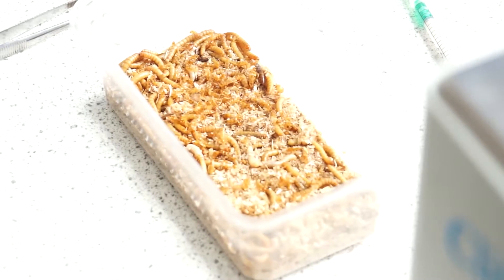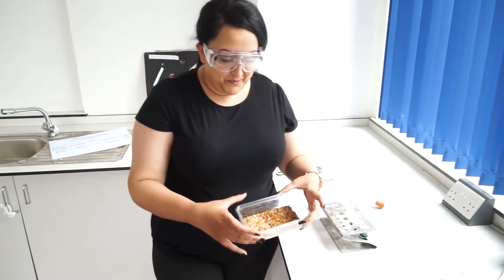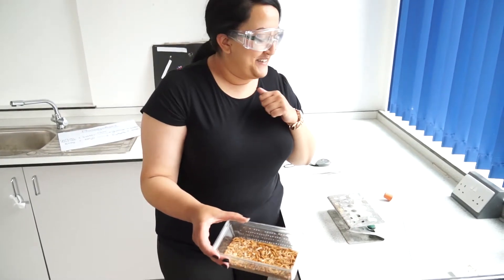This is topic seven practical, looking at respiration rates. In this experiment you'll be using some organisms — your teacher may provide you with maggots; these are mealworms that you can get from a pet shop.